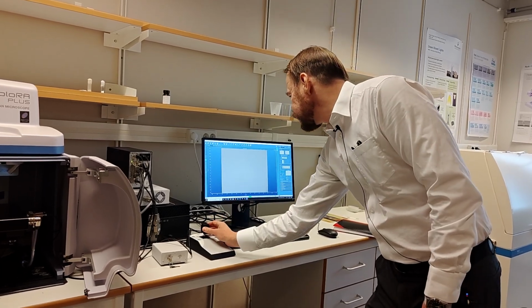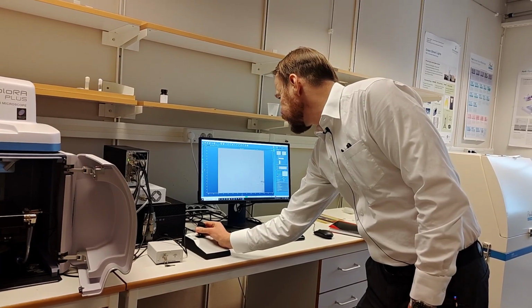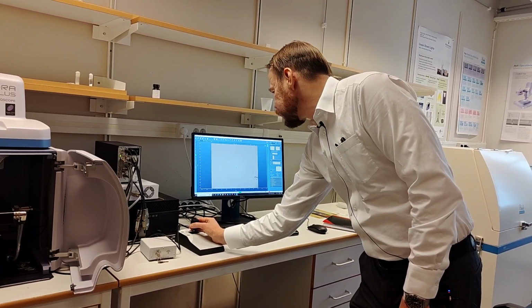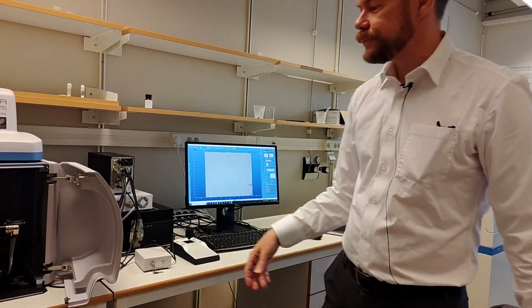See some dot there now, and try to translate around here. And there we have some more stuff to see. It's easy to see if there are bigger dots. So now it is in focus there, right? So now everything is set up to actually start the calibration.